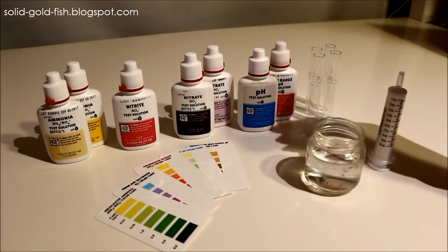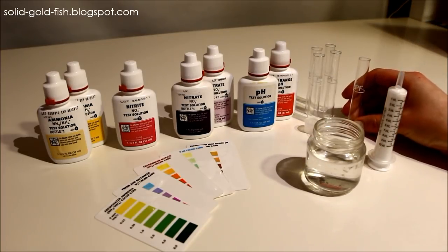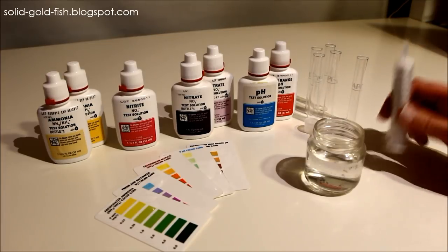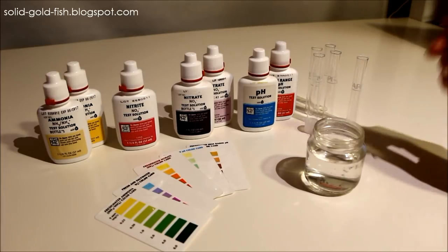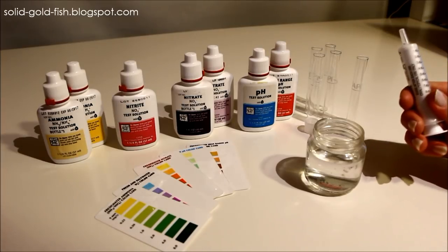It also avoids cross-contamination because if you have multiple tanks and you're dipping these in each tank, you're obviously cross-contaminating every tank. So if you have one syringe for each tank you avoid that.